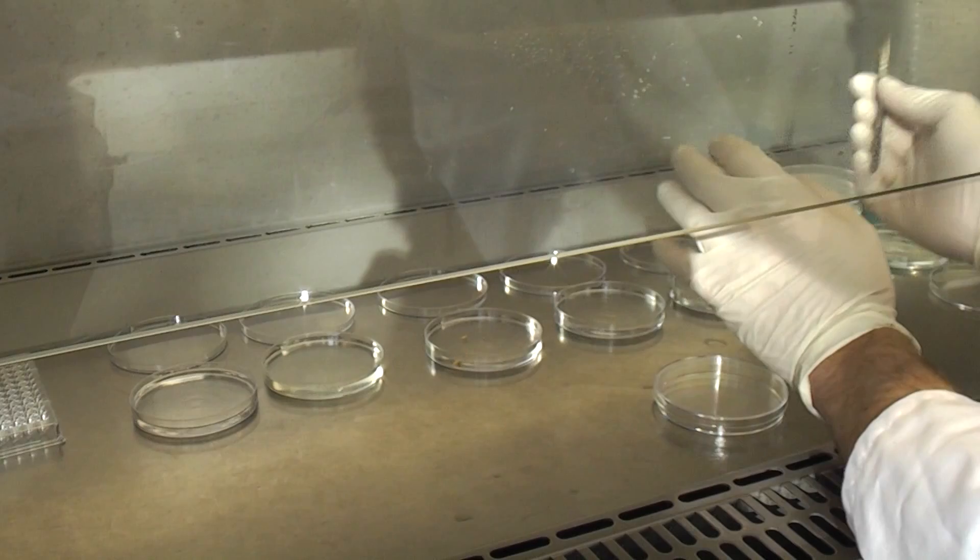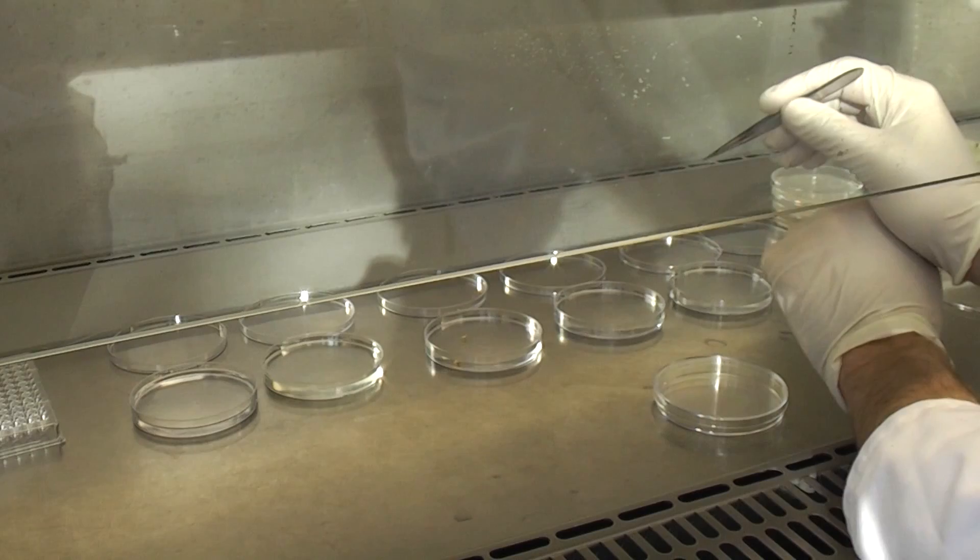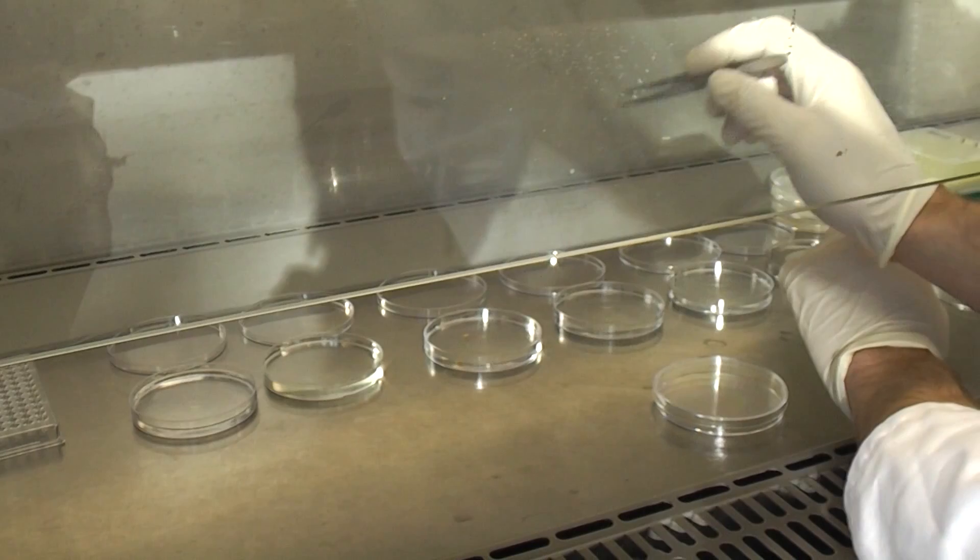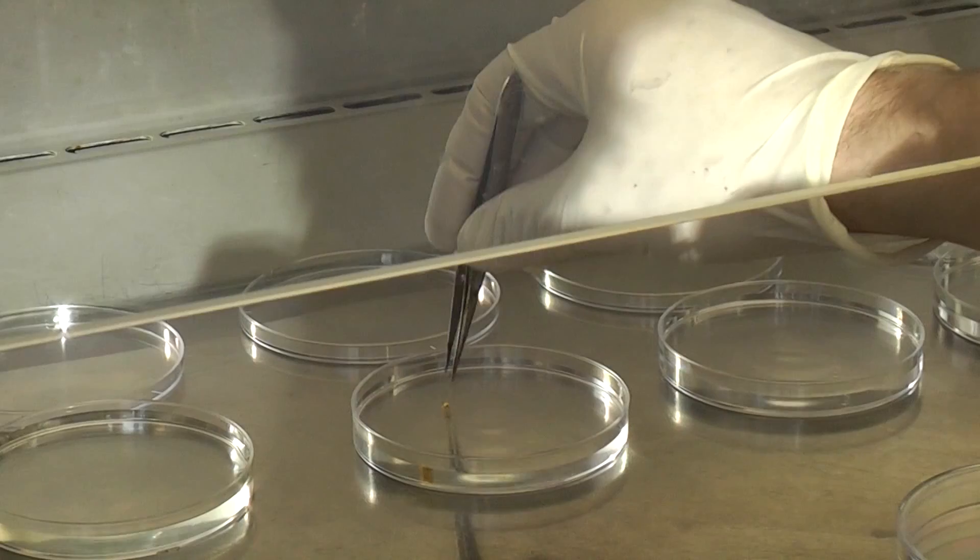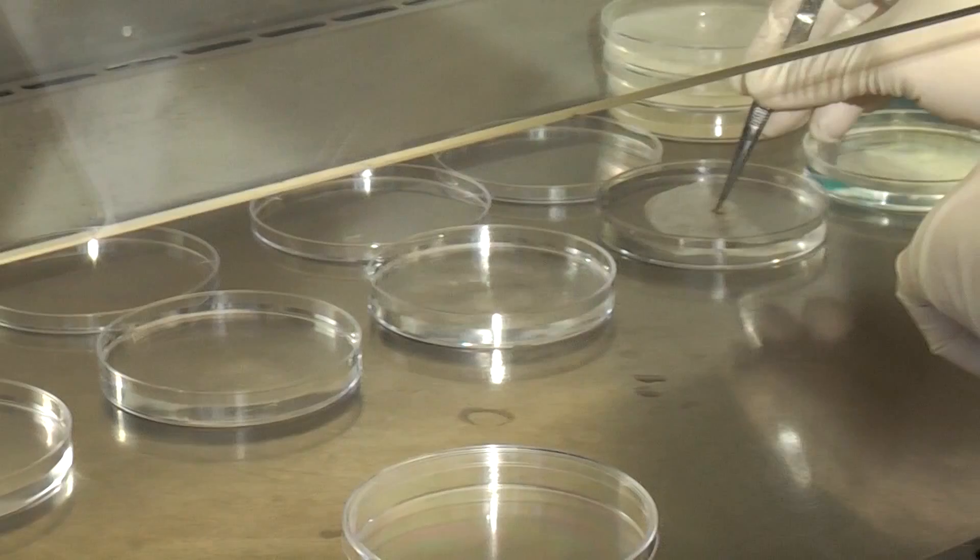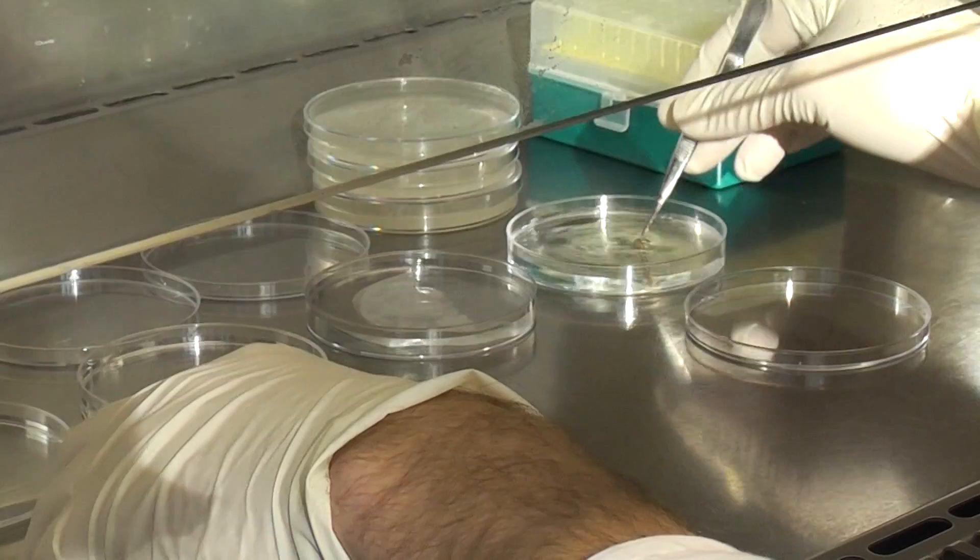So now what I'm doing is after that trial finished and I've taken some nodules back off the plant, I'm just checking again to see if the same rhizobia in the nodules that I initially used to inoculate the plant with. So now I'll just do the last couple of washes with water.